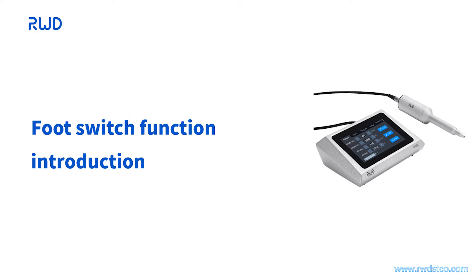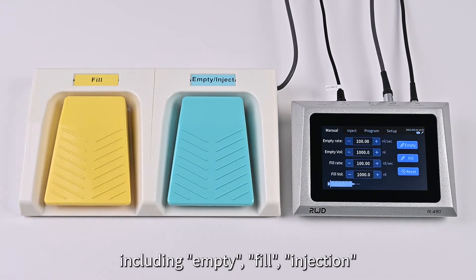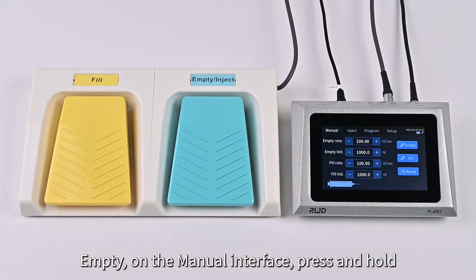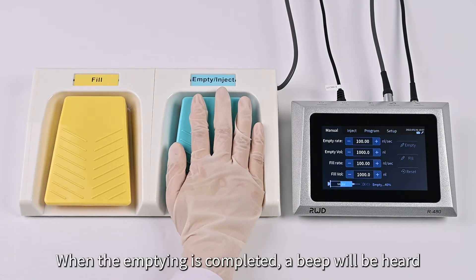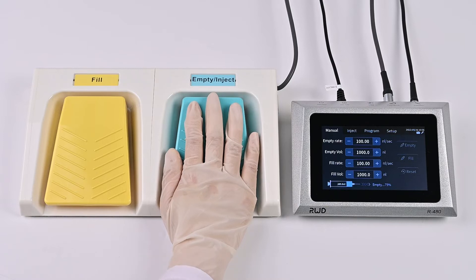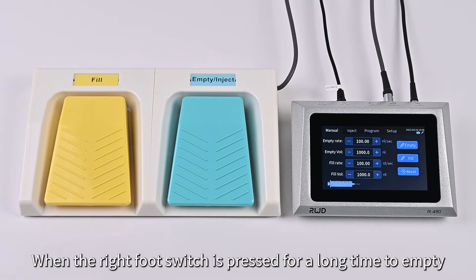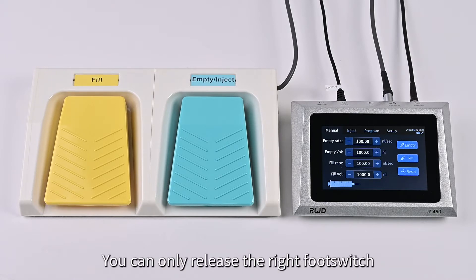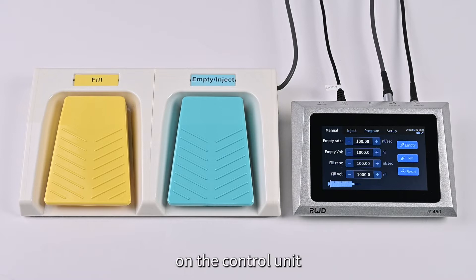Part 2: Footswitch Function Introduction. The footswitch can perform three functions: empty, fill, and injection. For Empty: on the manual interface, press and hold the right footswitch to perform emptying. When emptying is completed, a beep will be heard. Release the right footswitch to stop emptying. Note: the footswitch and the control unit are independent of each other during a process. When the right footswitch is held to empty, you can only stop emptying by releasing it — it is not possible to stop emptying by clicking the Stop button on the control unit.